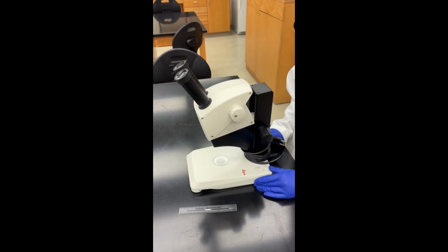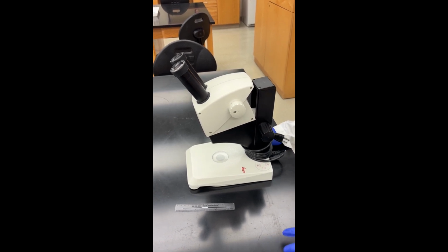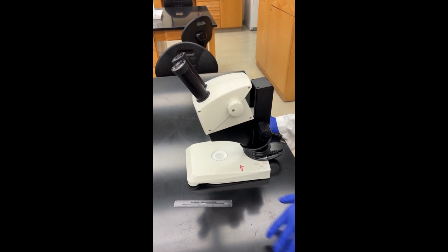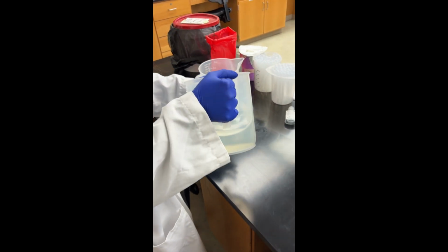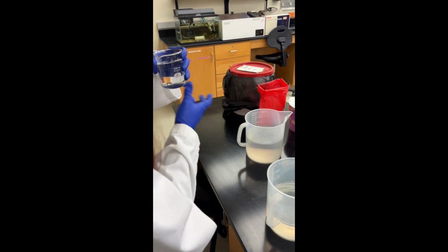Okay, for the second part of the experiment, we're going to be vacuum filtering 2 water samples to see how many microplastics and what kind of microplastics are present in both samples. I'm going to start by vacuum filtering 200 milliliters of FIU pond water. So I'm going to grab my beaker, go over here, and grab 200 milliliters of my FIU pond water. And then I'm going to go to my vacuum filtration set.